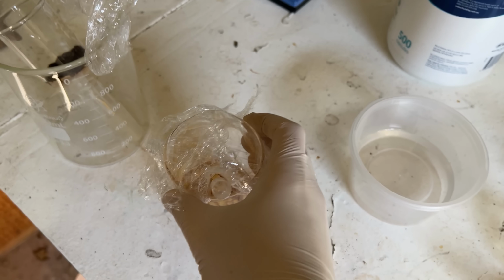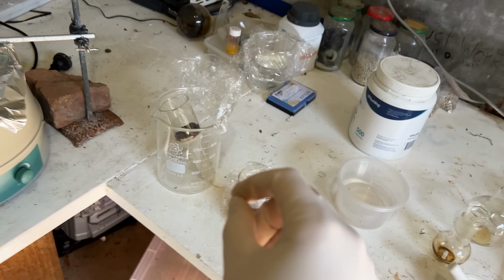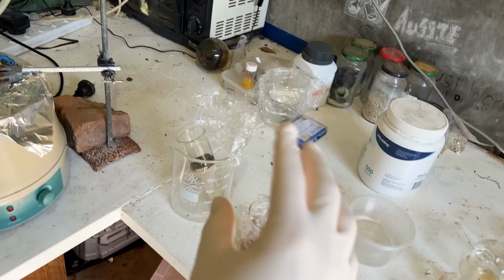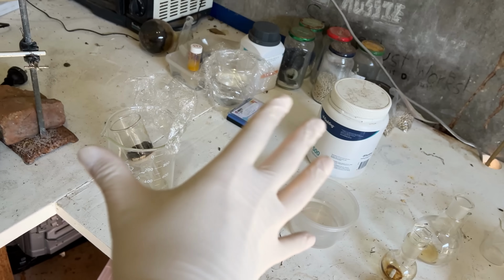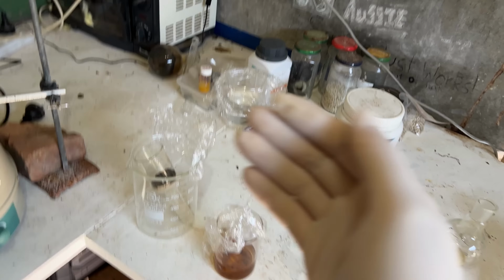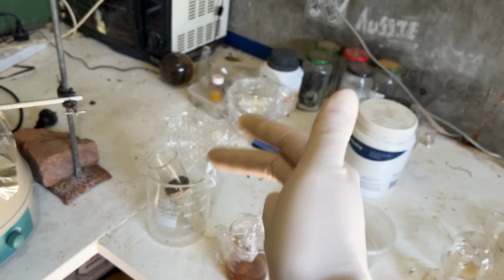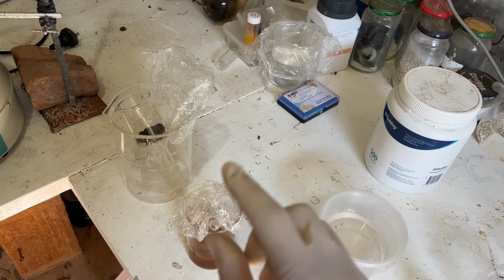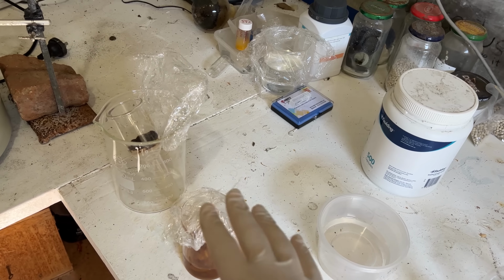Once we remove the crud, we can do a liquid-liquid extraction. So what the paper did, and once again, I keep deviating from the paper and it keeps punishing me for doing it, is evaporate it down under vacuum so you don't decompose any of the organic stuff. And then you have sodium bromide mixed in with your cubane dicarboxylic acid. I'm going to instead do a liquid-liquid extraction. So I'm going to use dichloromethane. Dichloromethane is not going to mix with the water.